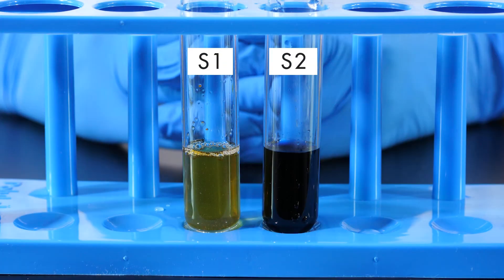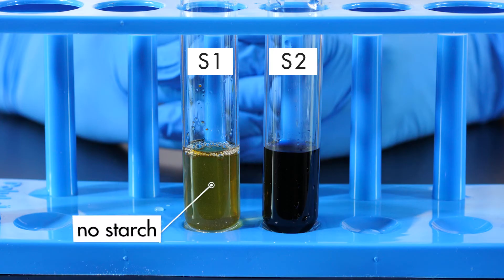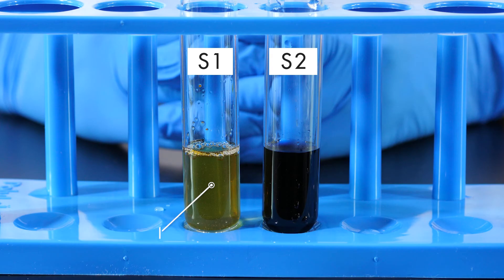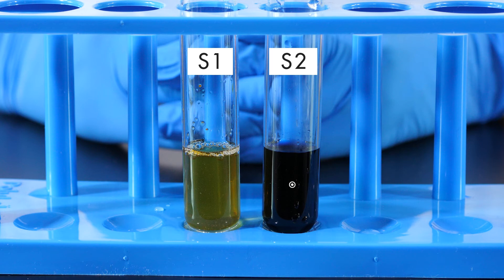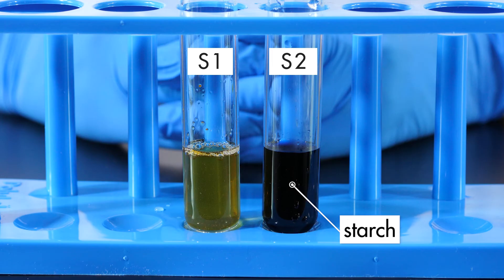Notice that the solution in test tube S1 turned yellow, not black. This indicates that starch was broken down into glucose by the enzyme amylase. The solution in test tube S2 turned black, indicating that starch is present and no starch digestion took place.